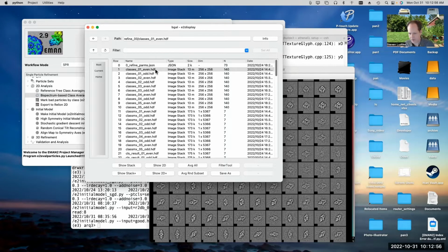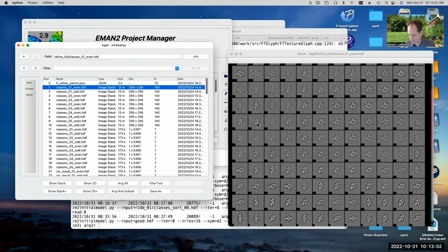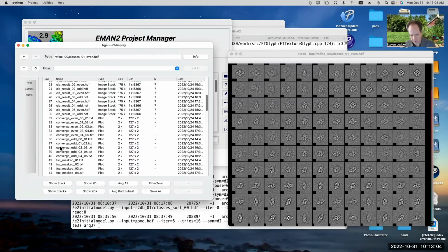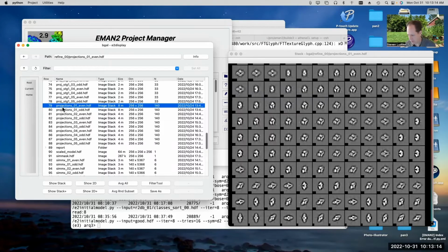So you can look at the class averages, and if you want, you can compare the class averages to the projections. If I scroll down here, as soon as I double click on projection 01, it'll switch all of these with the corresponding projections. Ideally, they should all look the same. Obviously, if you have some class averages which are really noisy, they're still going to look really noisy. There's nothing to do about it.